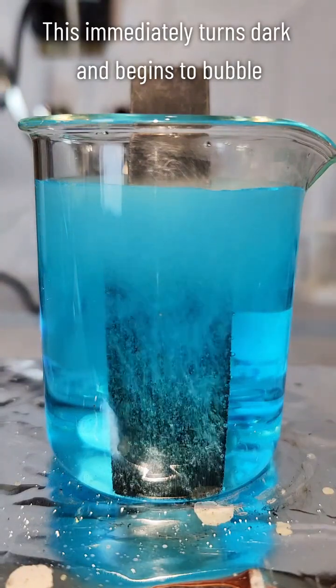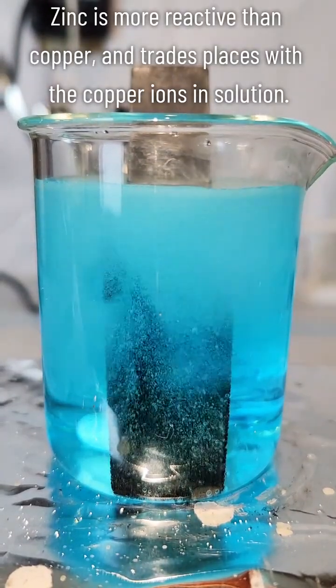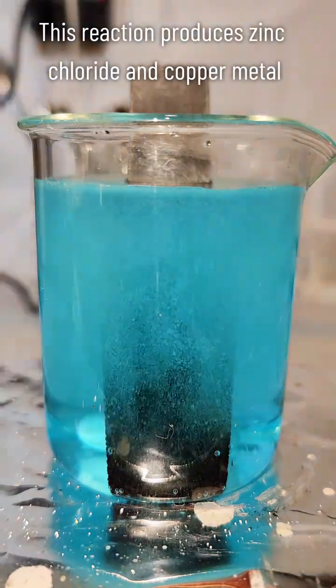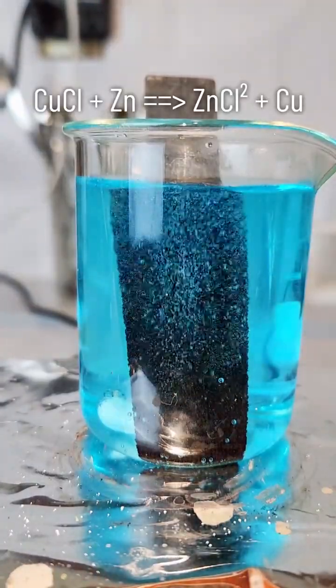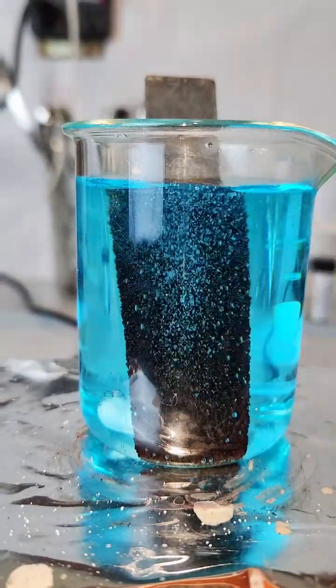A single displacement reaction generally always takes place between an element and a salt, where the anion on the salt moves from the less reactive element to the more reactive element. In this case, the chloride anion is moving from the less reactive copper to the more reactive zinc, forming copper metal and zinc chloride. Hydrogen gas is also produced in this process, which is why it bubbles so much.